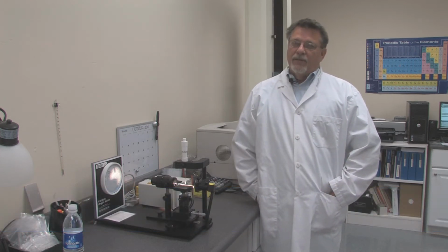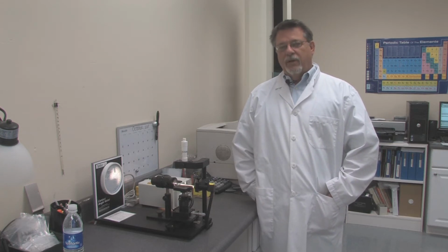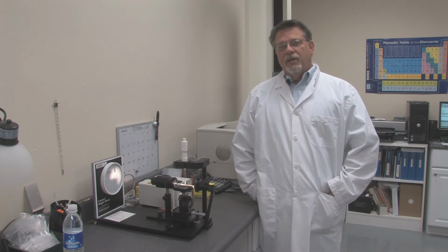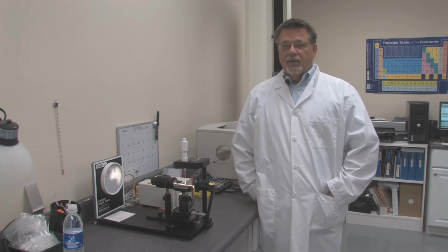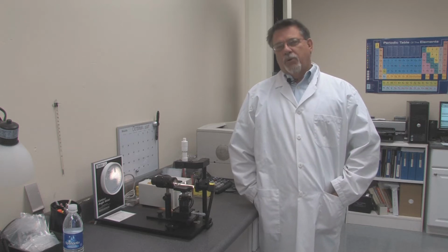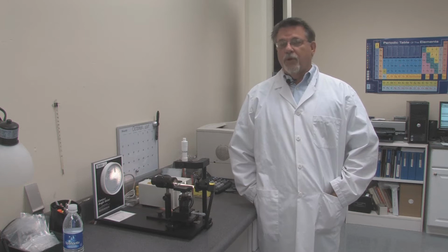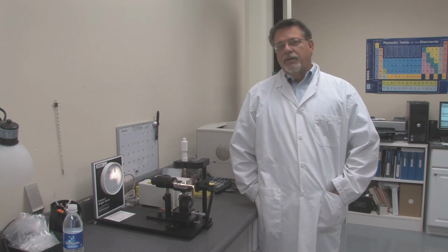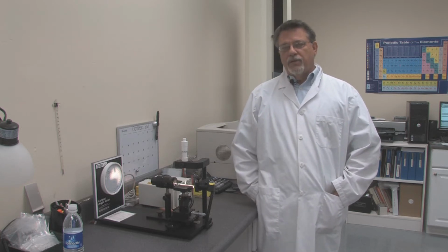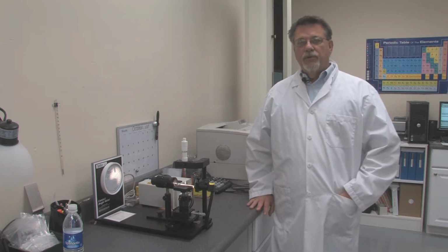I'm in the lab again, and today we're going to talk about analytical services. This is one of the advantages that we have here at TriStar, in that we can not only analyze materials that come in from customers to identify them, but we can also do our own internal testing to identify whether our processes are in spec, or in the case of some of our customers, if their processes are in spec. So we're going to take a quick tour of some of the pieces of equipment we have in the lab and talk to you a little bit about how we use them.